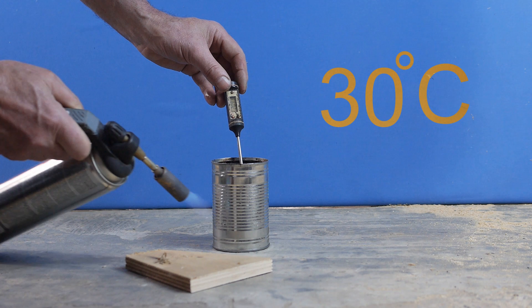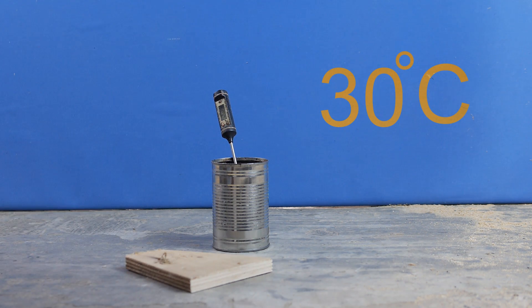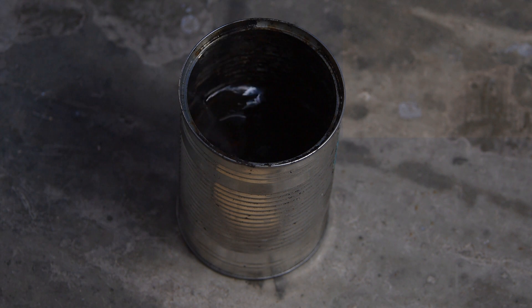It still hasn't flashed, but being kerosene, it probably will soon. So we'll heat it up, this time to 35 degrees.